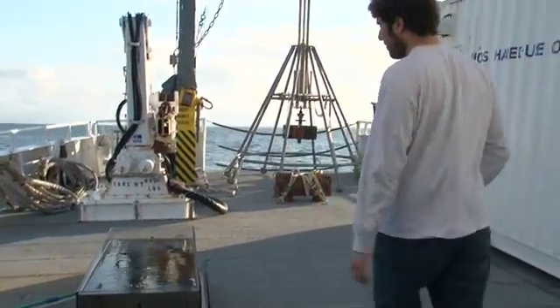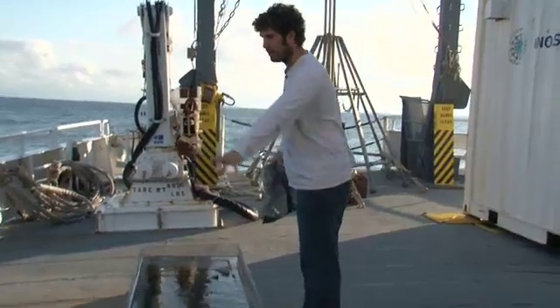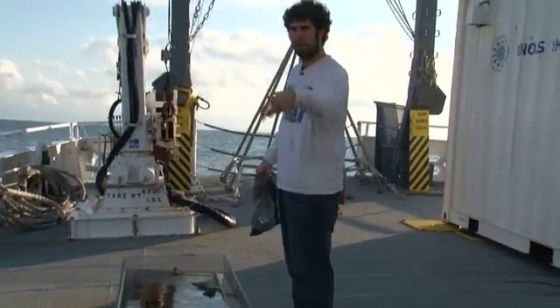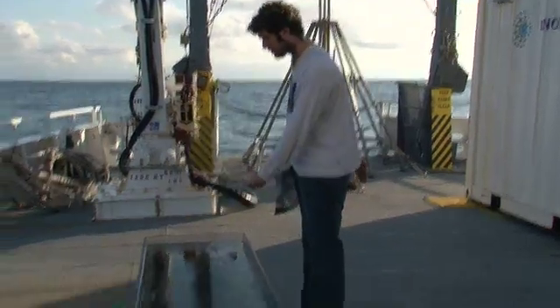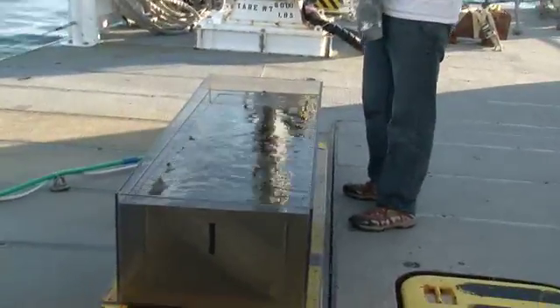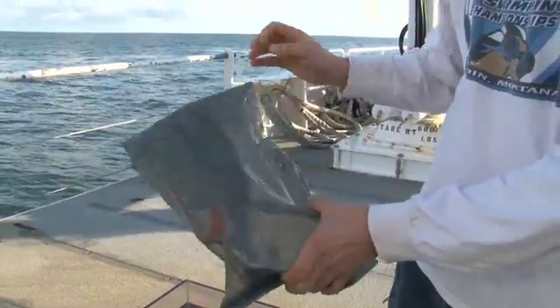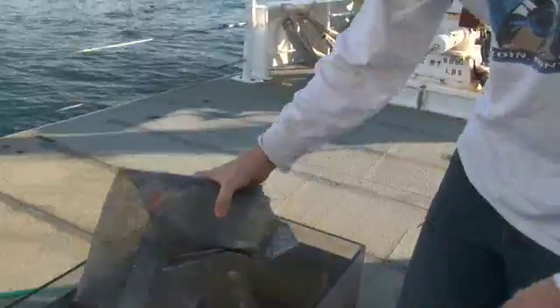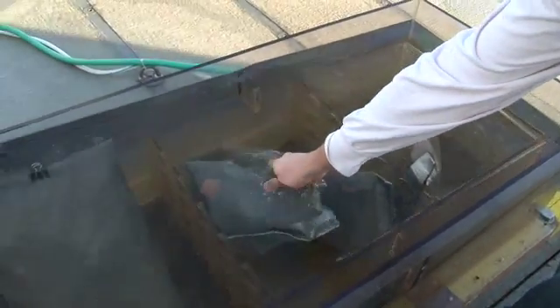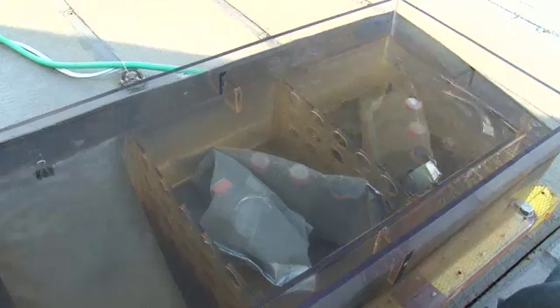So this is the incubator. It just has a hose running water from the surface into this to keep it at the temperature of the ocean water. Pretty simple — you just set the sample in here, make sure it's pressed down so it doesn't fly off, and you just let this sit overnight.